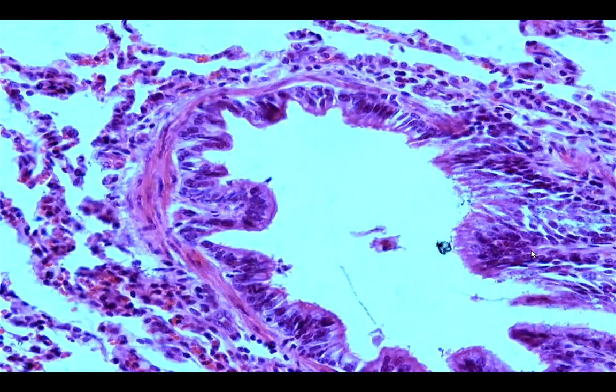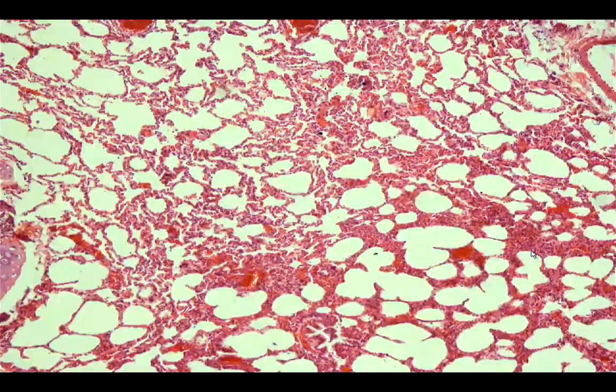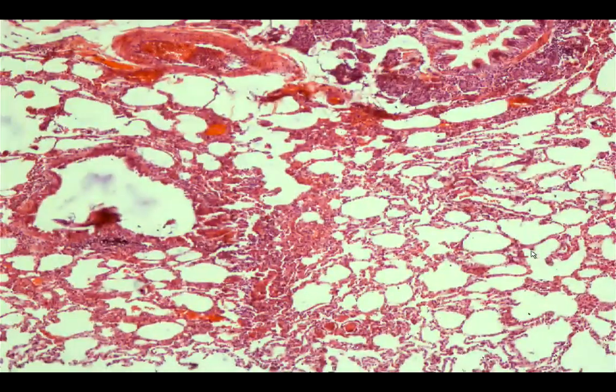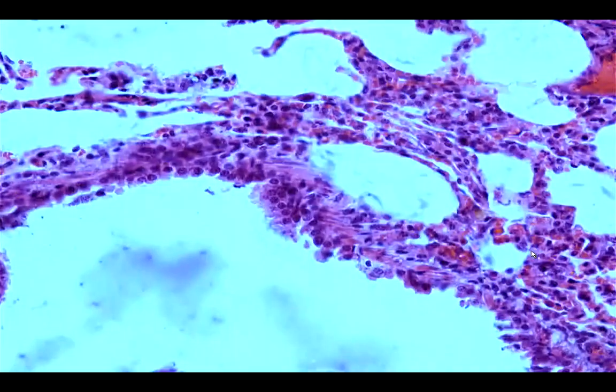Looking for a true bronchiole: the lining epithelium here is simple columnar to cuboidal. There are no cartilage and no glands in the submucosa. So this is an example of a bronchiole. The bronchiole is around one millimeter or less in size, with no cartilage and no submucosal glands.